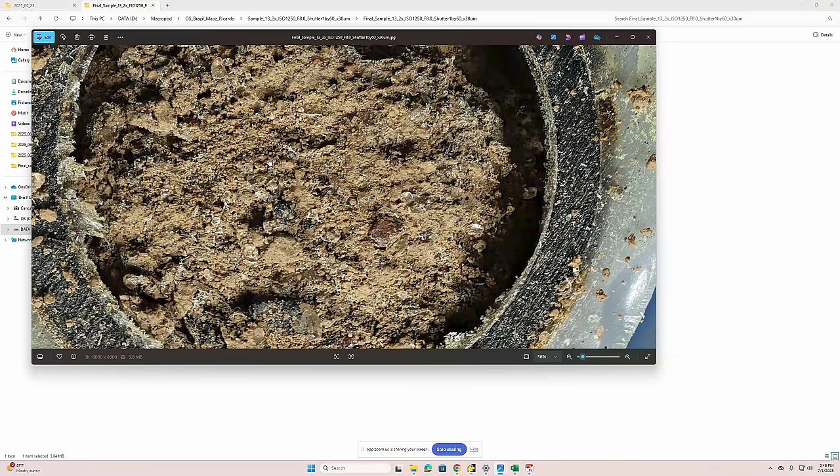Are these the ones? Can you hold it up? Yeah, it's the one in your left hand. This one? That one, yep. Okay. You also have this one too, but that one is for the 100 millimeter. Yeah, and you do want to use that for the 100 millimeter if you have it hooked up. That's going to improve lighting quality much better for the 100 millimeter.